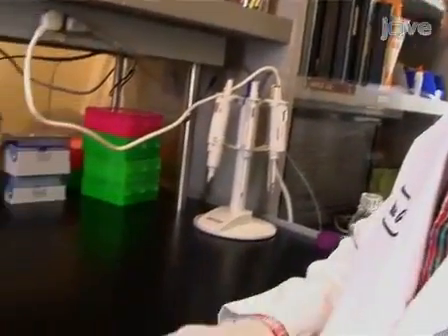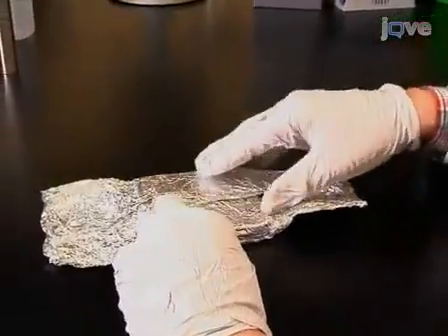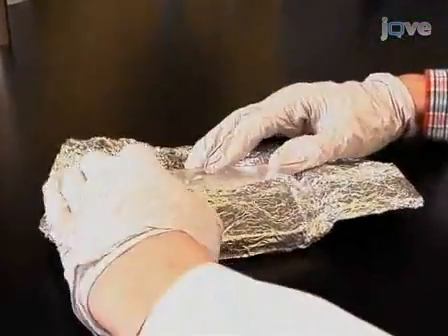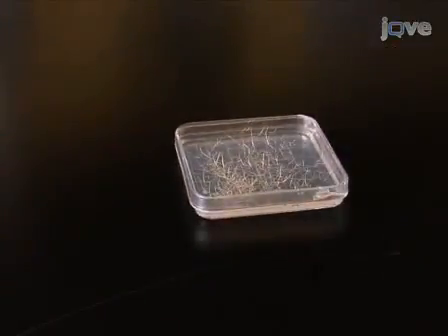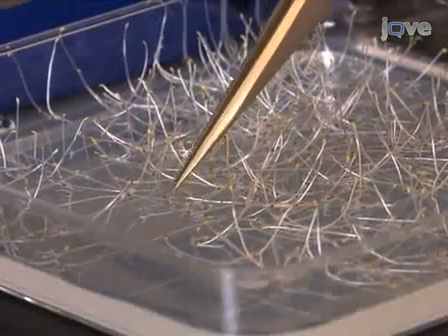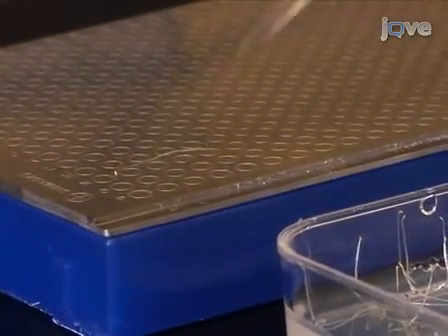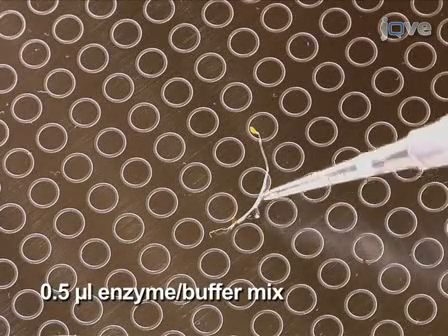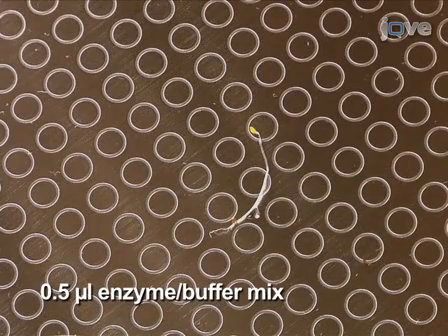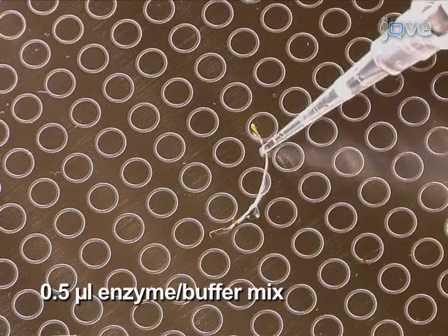The OLIMP method demonstrated in this video can also be used directly on the plant tissue, omitting any wall preparation steps. This in situ analysis procedure is demonstrated on dark-grown Arabidopsis seedlings. The specimen is placed directly onto a target plate and air-dried. To the dry seedling on the plate, add 0.5 microliters of the appropriate enzyme buffer mix at the desired positions. Make sure that the enzyme drop touches partly the tissue and the target plate.